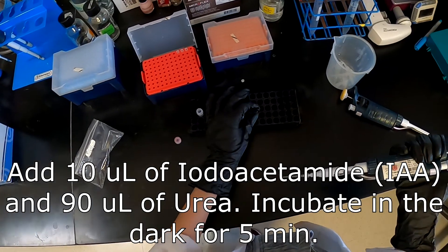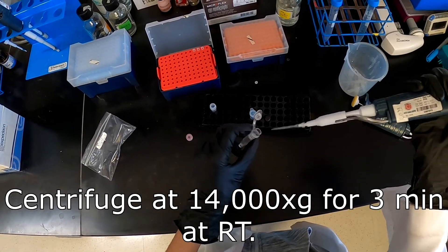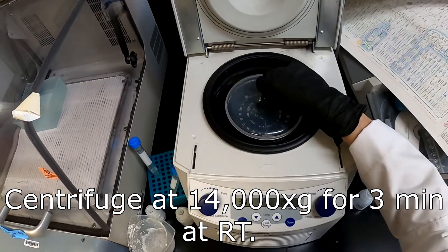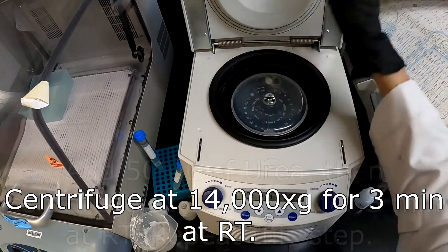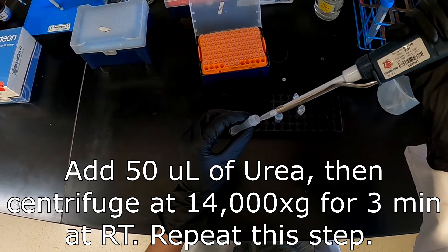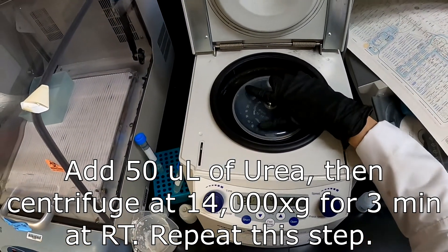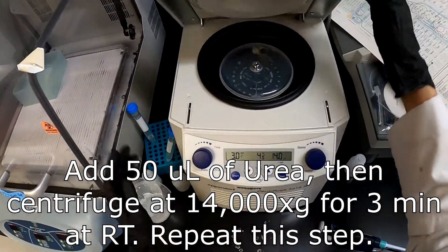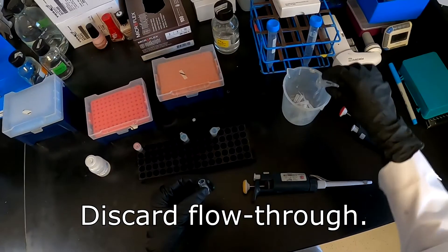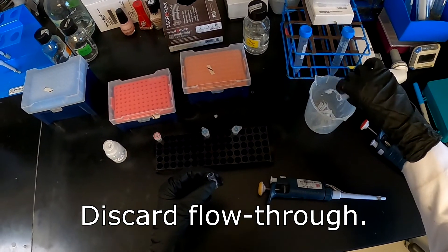The sample was then centrifuged at 14,000 G for 3 minutes at room temperature. 50 microliters of urea was then added to the filter. It was then centrifuged at 14,000 G for 3 minutes at room temperature. The flow through was then discarded after this wash.